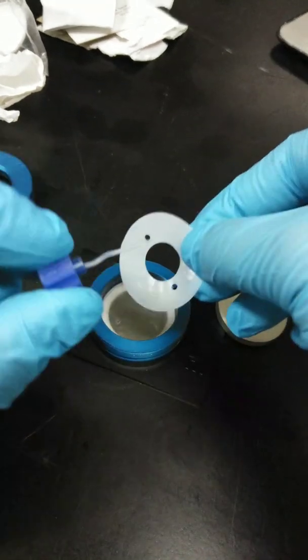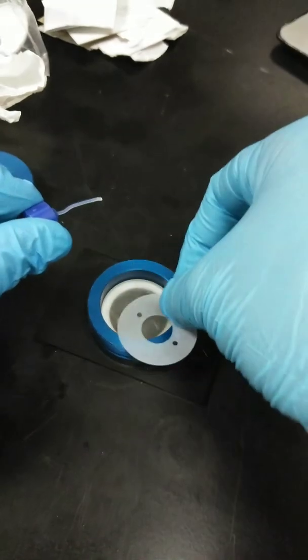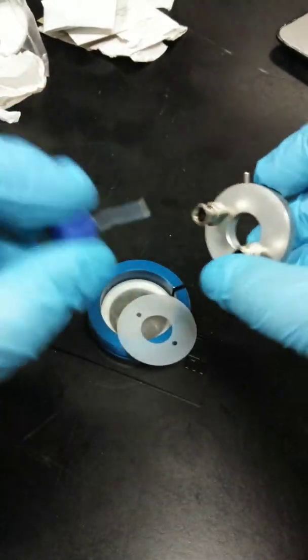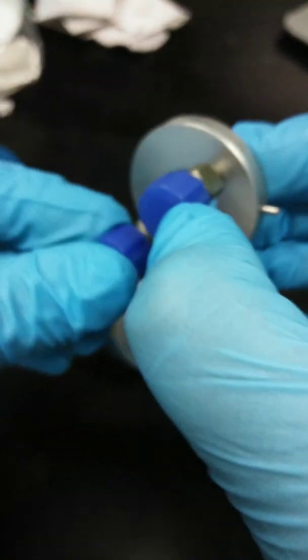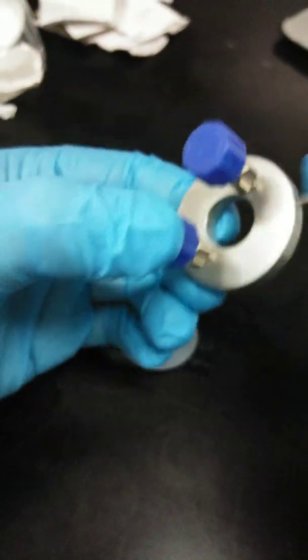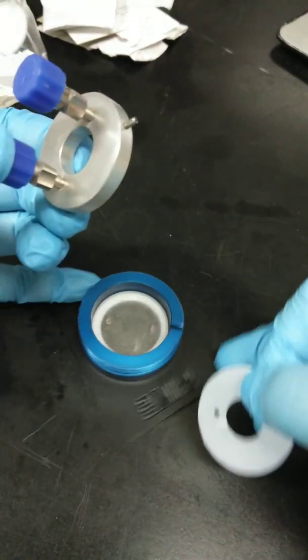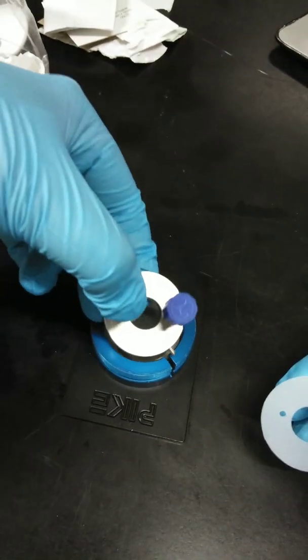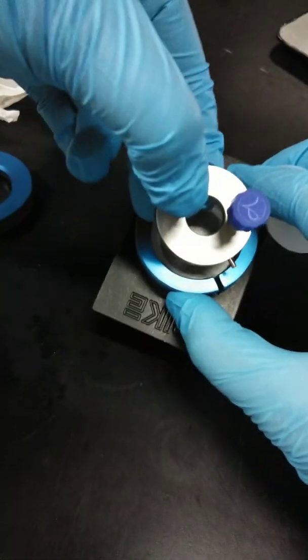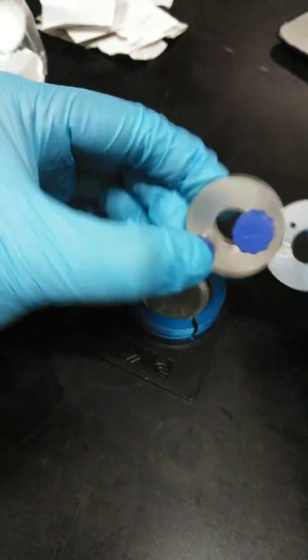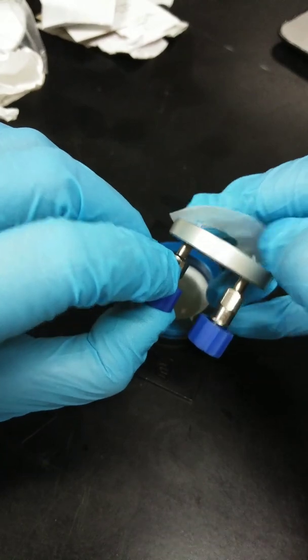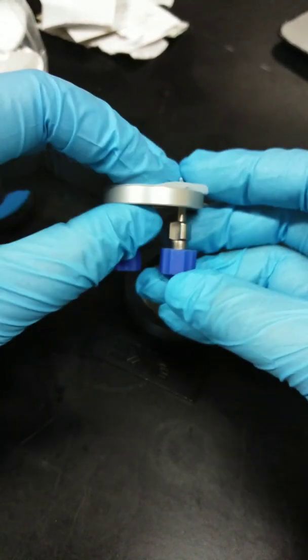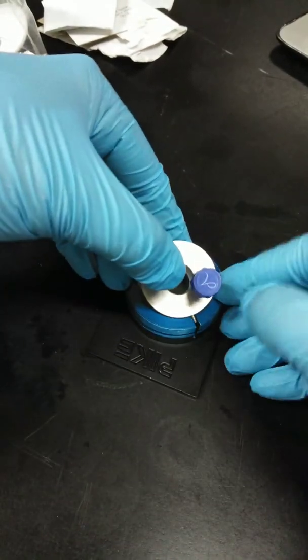So the technique is to insert, before inserting it here, insert this part here first. And you will see that it will be extended at the bottom. So do the same thing for the second one. And notice that this protruding metal here will determine the orientation on top of this cell holder component there. But before doing that, we have to insert first this gasket. So you have to make sure that it's inserting at that hole. And the other hole. And then, fill it on the top.